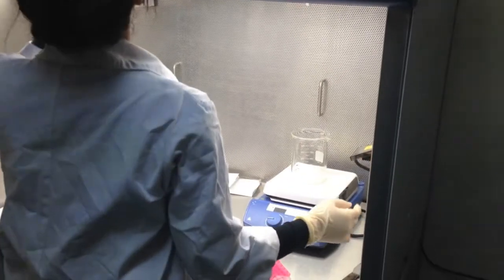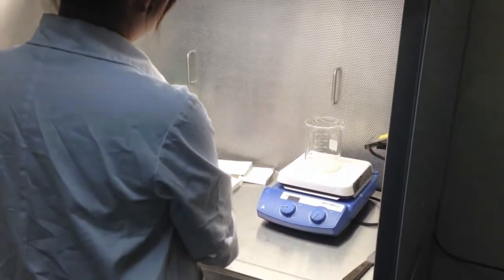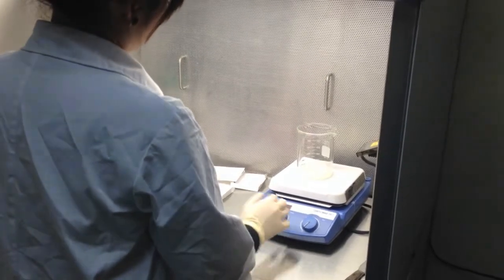Basically it involves complex mixing and procedures of pharmaceuticals. Today we are going to show you how we manufacture troches.